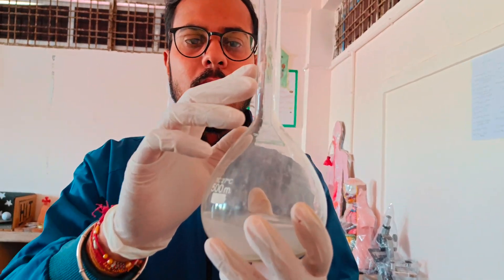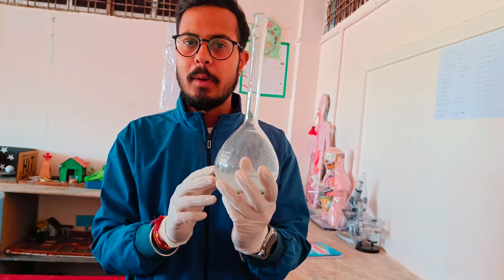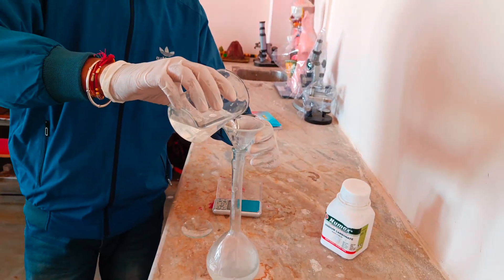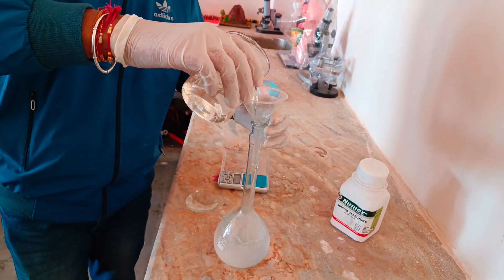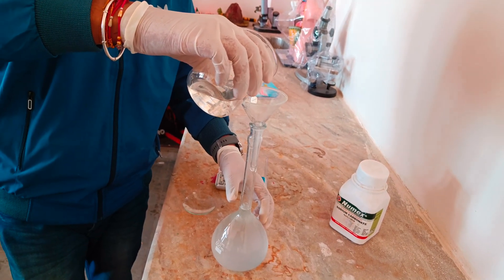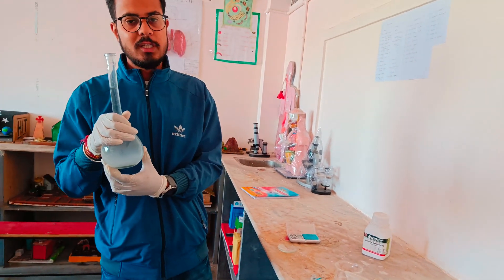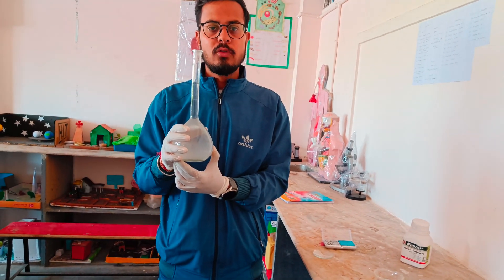Now we will fill up to the 500 ml mark with water. The sodium carbonate solution — 0.1 molar 500 ml sodium carbonate solution — has been successfully created.